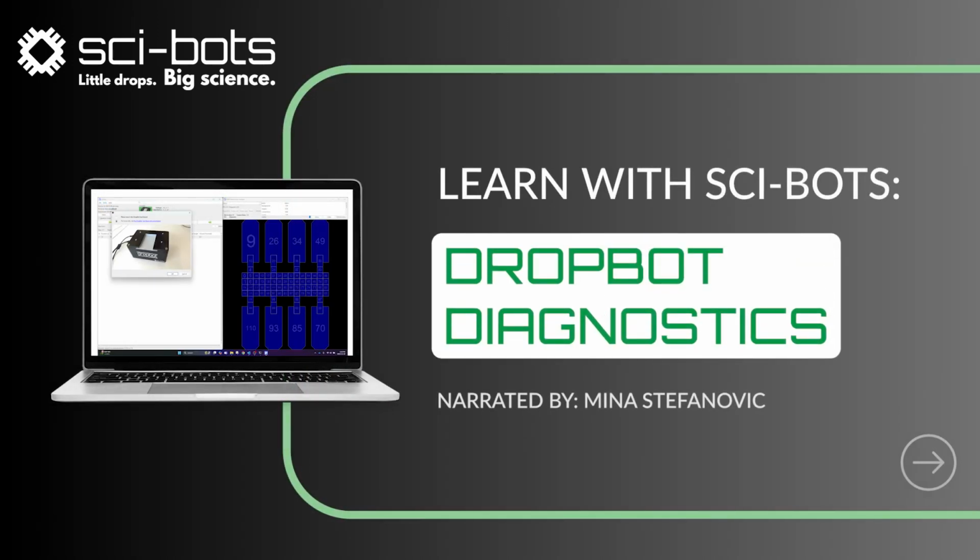This DropBot tutorial will walk you through how to perform a diagnostic test on your DropBot to ensure that your system is functioning correctly. Let's get started.